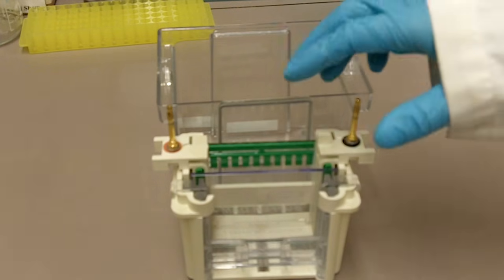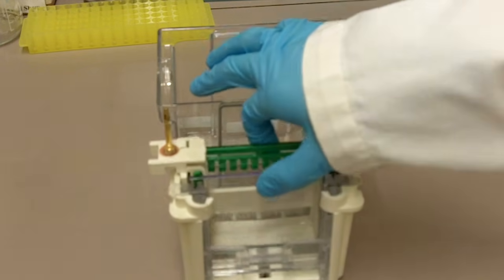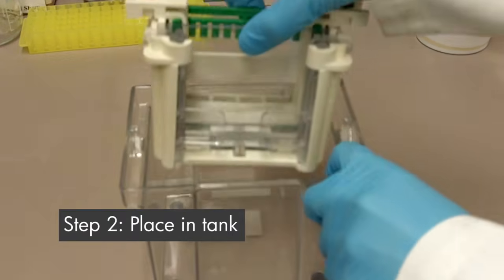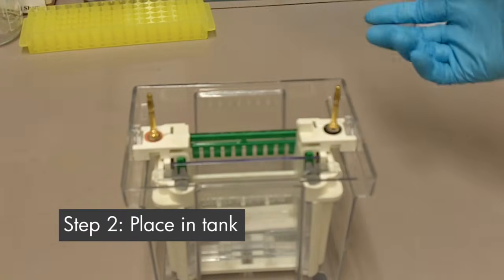After you have assembled the center piece, you'll need to put it into the tank. It just sits in like that.